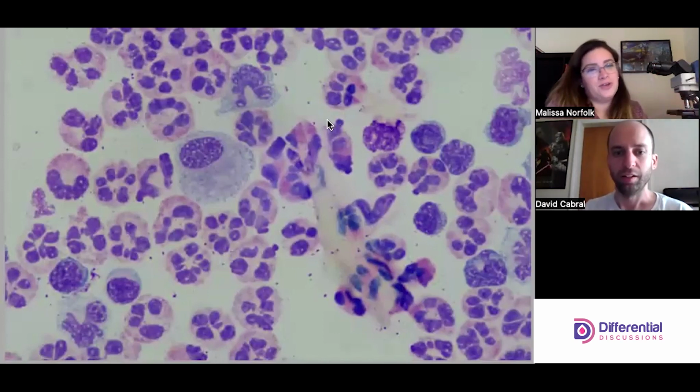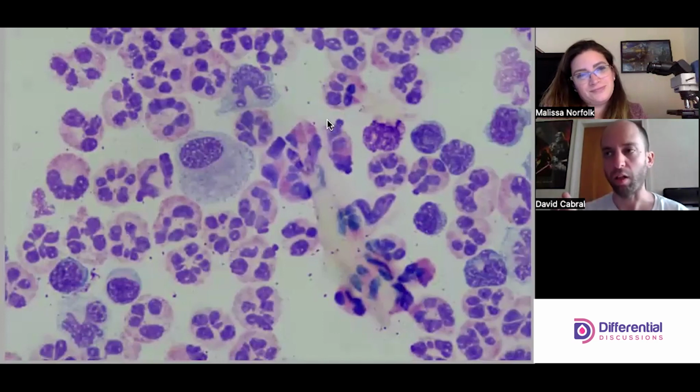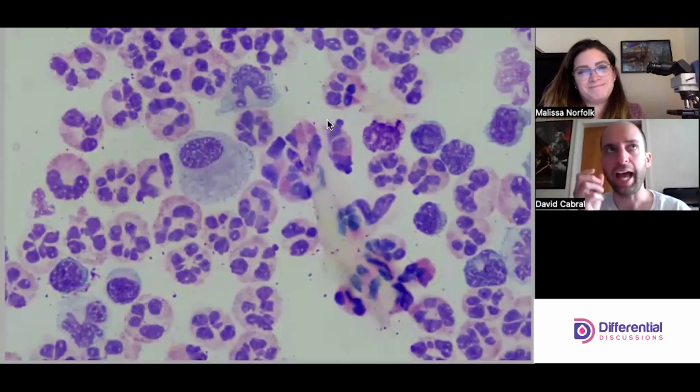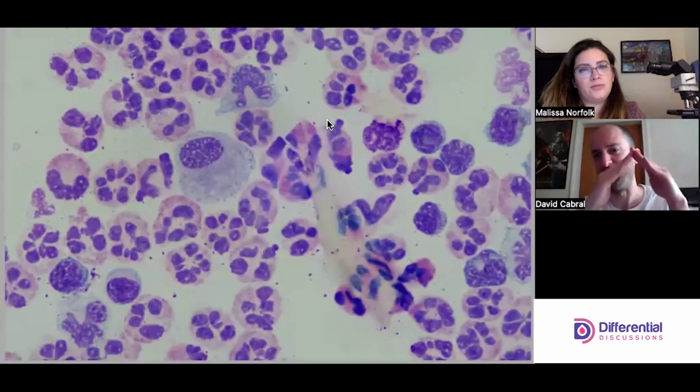Intracellular bacteria is bread and butter for a synovial fluid. That is the gold standard. Even those of us who have done this for years will always struggle: is that an organism, is that not? Intracellular, you'll see they have a prettiness, an evenness to them. They're exactly like the shapes that you expect. So don't twist yourself into a pretzel over whether a piece of junk that's got edges or something is bacteria.